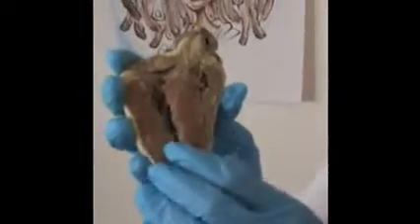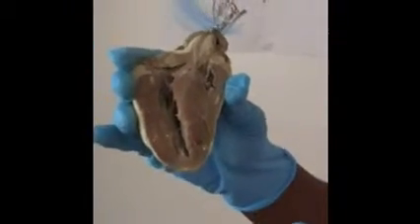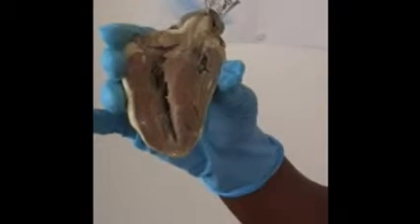Next we have the papillary muscle, which is on the left side of the heart, which is down here. And then we have the pulmonary semilunar valve. That leads down from the pulmonary trunk into the right side of the heart. And then we have the aortic semilunar valve, which is on the left side. It's going to be right in there.